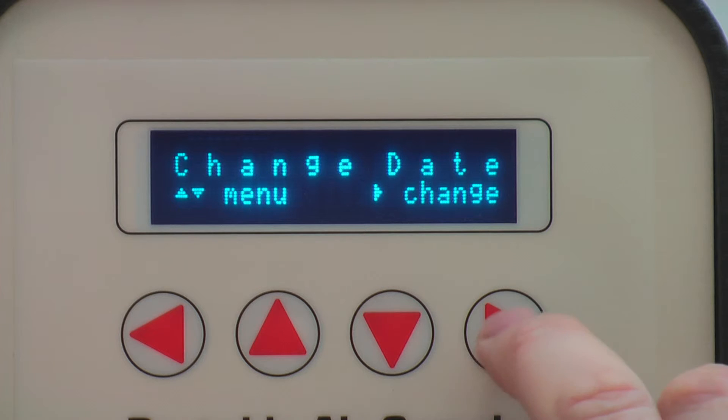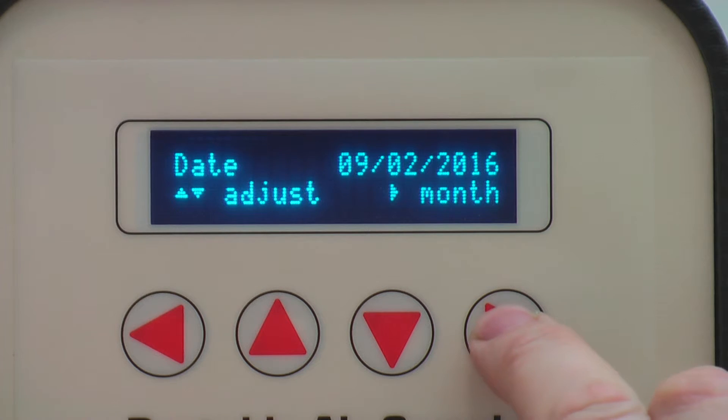Date can also be saved in a similar way. First press the day, then the month, and finally the year. Press right to save the new settings.